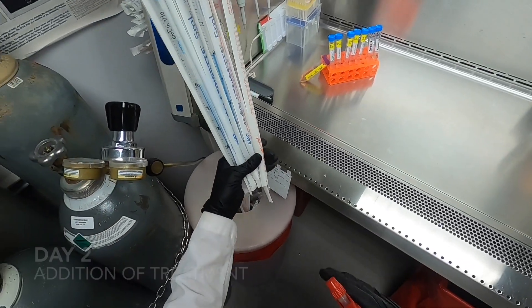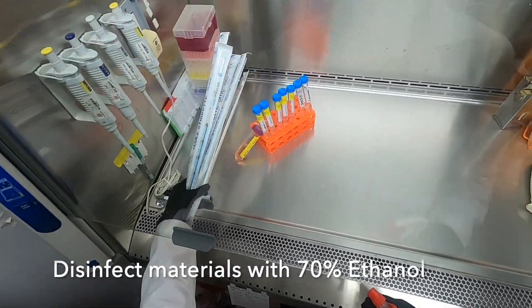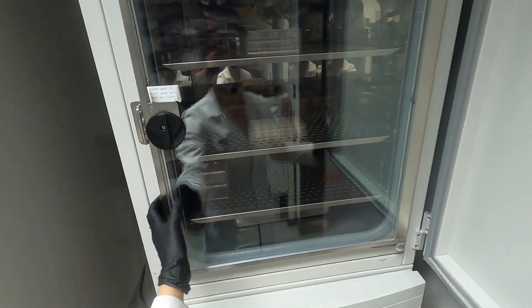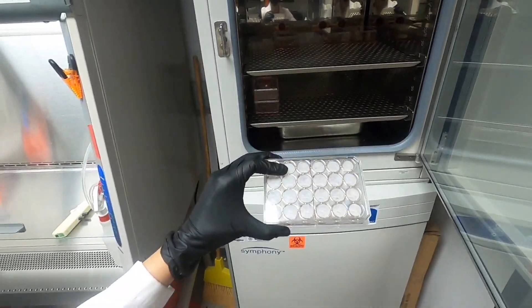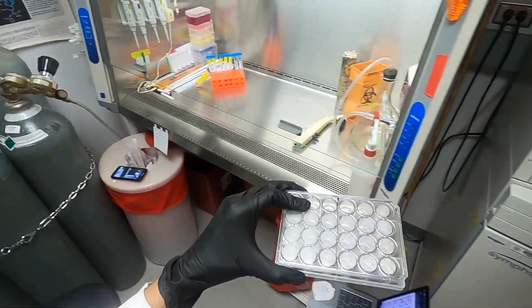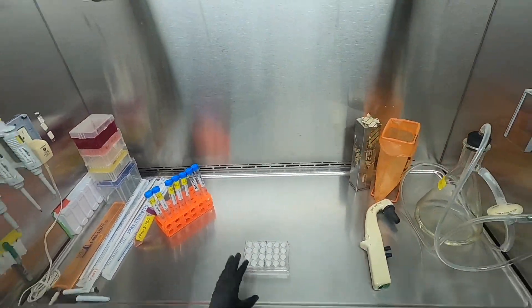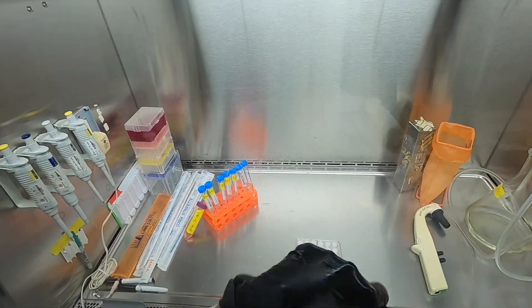We can then seed the appropriate number of cells and incubate the plate in order to allow the cells to attach. Now that our cells have attached to the plate, we can begin with our treatments. We begin by disinfecting all of our materials with 70% ethanol. In our last two videos we made serial dilutions of capsaicin using a 96-well plate, but this time I have already made the dilutions in 15 ml conical tubes.